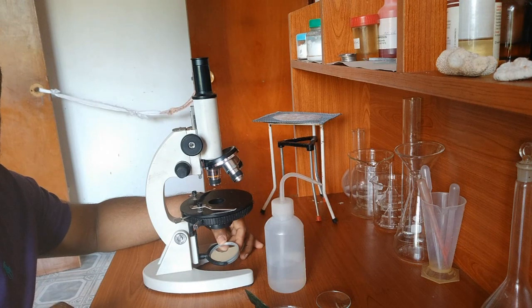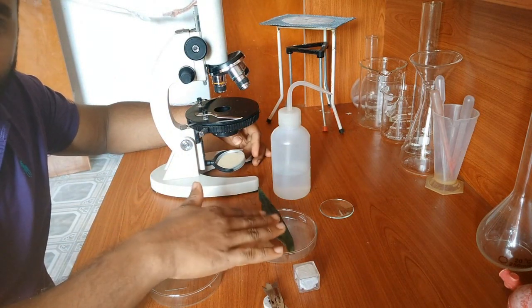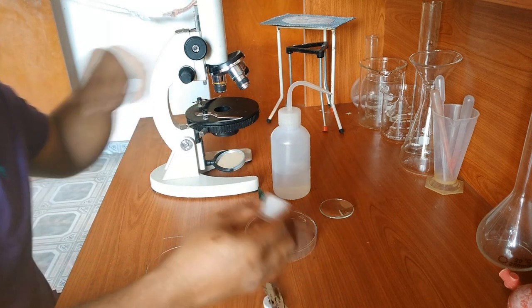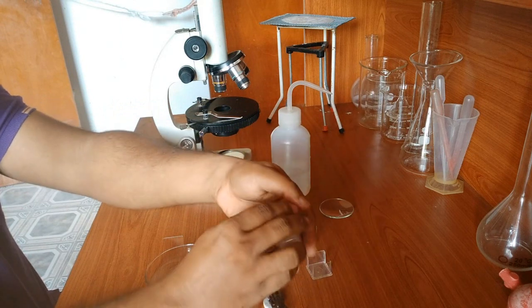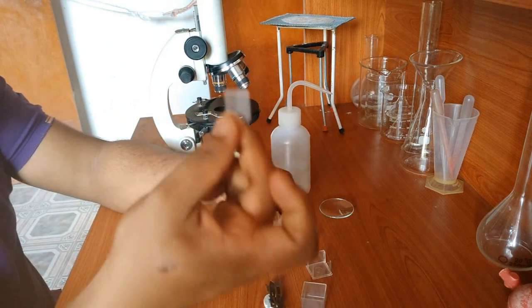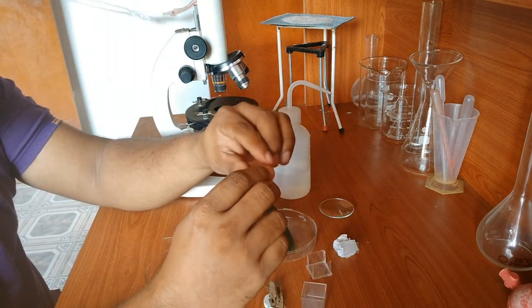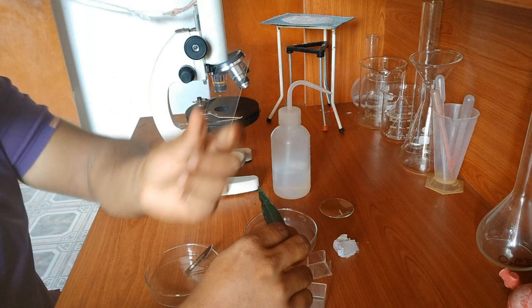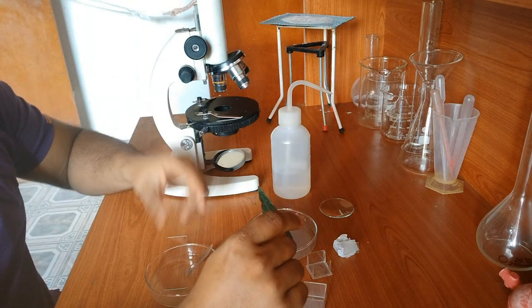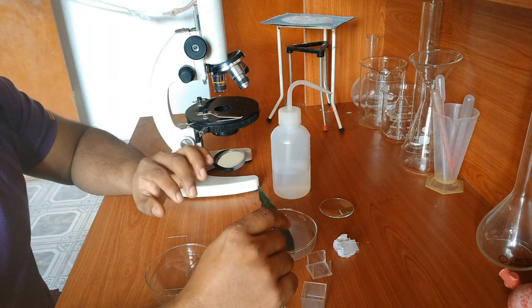We need some stuff. This is water bottle. We need a petri dish containing the sample, and we need cover slips. I'll take one slip and see. You can see that. This is we call the cover slip. So this cover slip is used to cover the specimen without contacting directly with the lens, because otherwise when the water is present, so we are adding water to this slide. This is called the slide. So we are adding water. So if the water touches this lens, the lens start to get damaged, because fungal growth will happen due to the moisture, right? Okay, let's see what we're going to do.